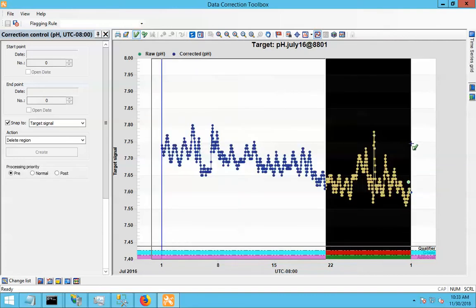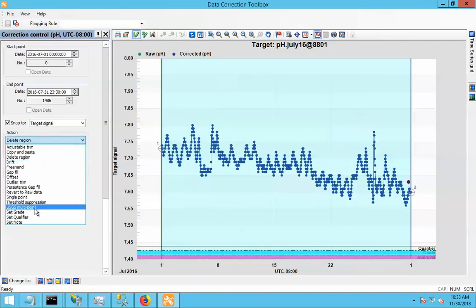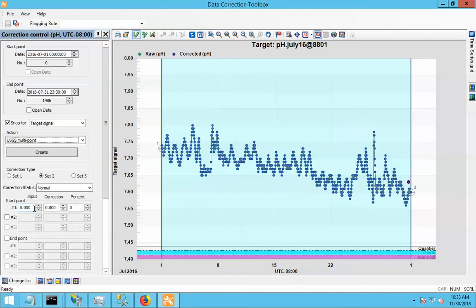Select that section of data. Choose the USGS multipoint correction. And since I'm doing a fouling correction here, I'm just going to set the correction type to set 1. It doesn't actually change anything. That's just the convention. People do their fouling corrections on set 1, their calibration corrections on set 2, and other corrections on set 3. It just happens to be the way the USGS does it.